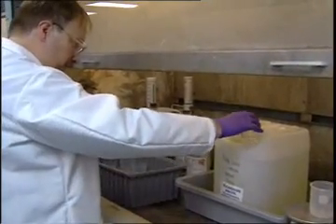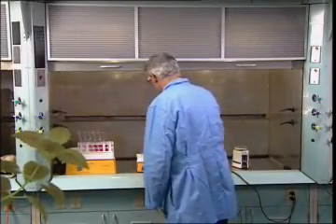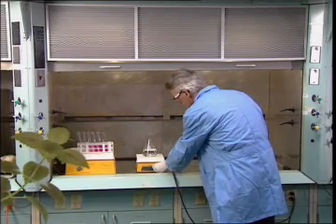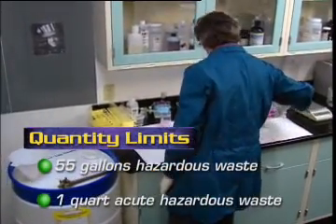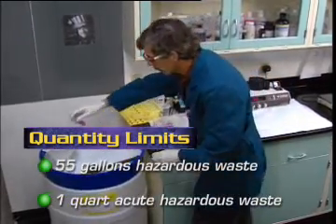Wastes may be accumulated in a fume hood, but should not be kept in a hood that is regularly used for lab procedures, especially if the procedures involve other hazardous or incompatible substances. According to regulations, no more than 55 gallons of hazardous waste or 1 quart of any acute hazardous waste may be accumulated in a satellite area.